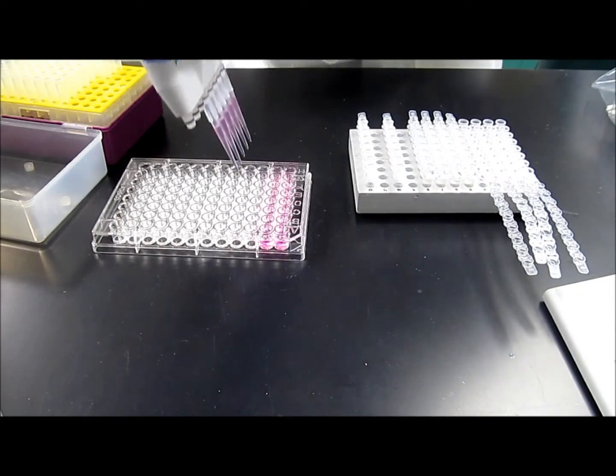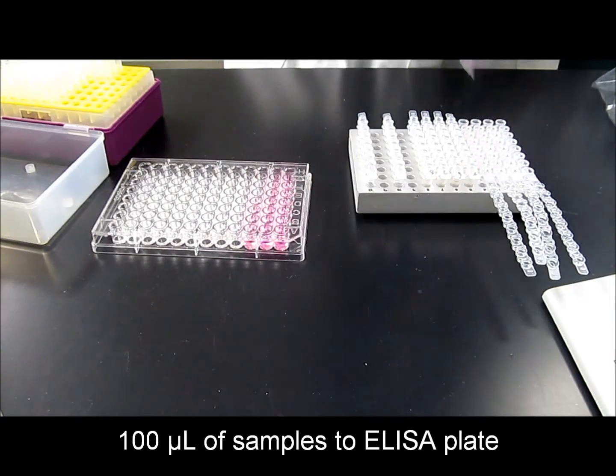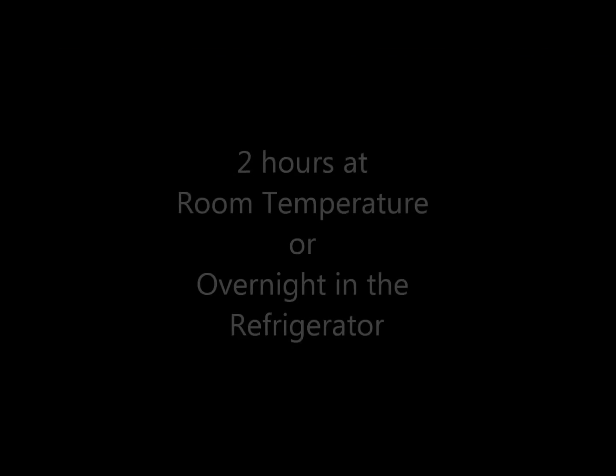Once your samples and standards are ready, add 100 microliters of each to the appropriate wells of the ELISA plate. Seal the plate and let it sit for 2 hours at room temperature or overnight in the refrigerator.